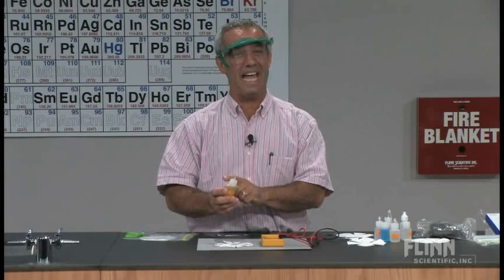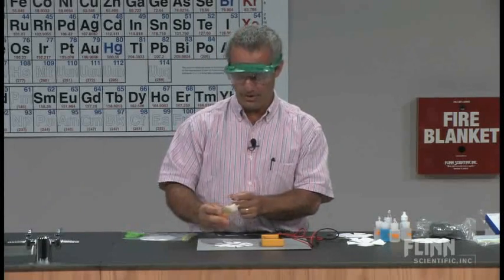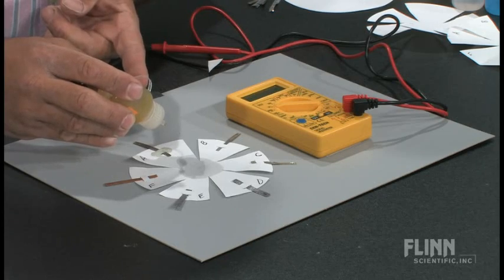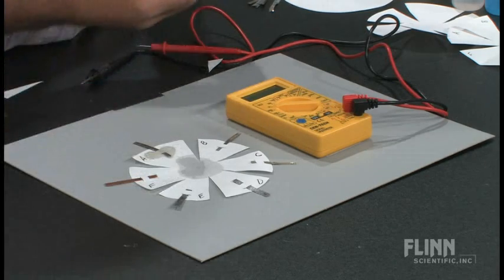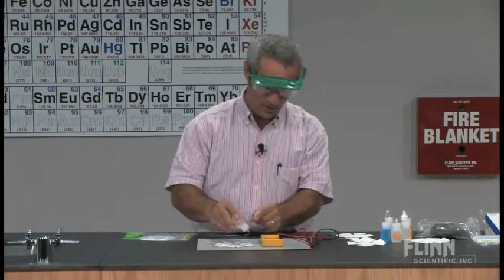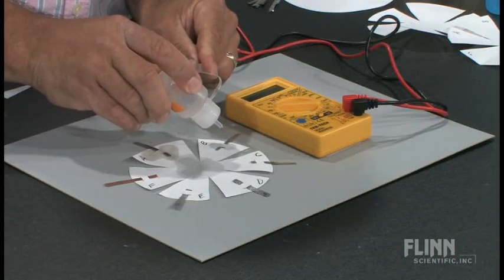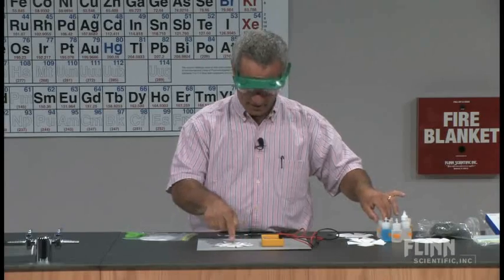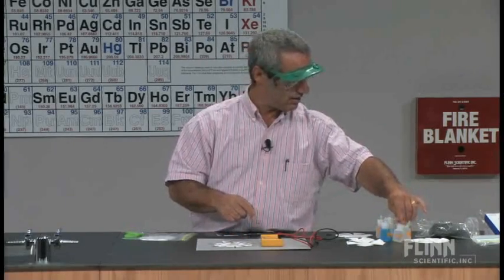Here's some solution A. They are unknowns. A goes with A, so we're going to put five drops of that here. B, let's see, where's my solution B? It goes here. You're saying that's not enough. It's not, they're starting to meet here. That's all you need. It's just enough for them to make contact.